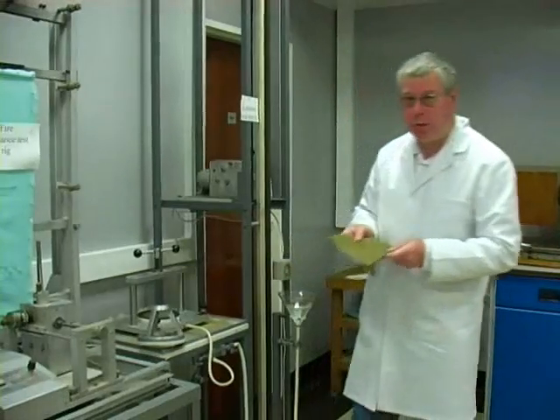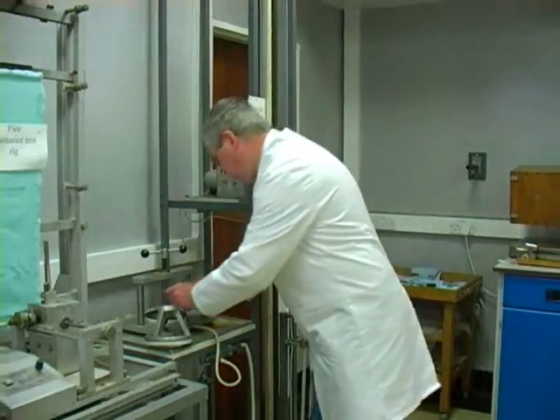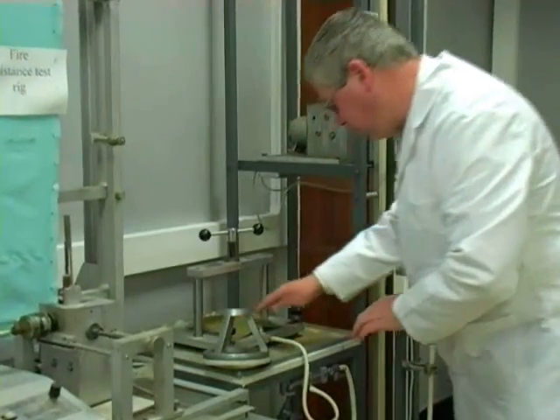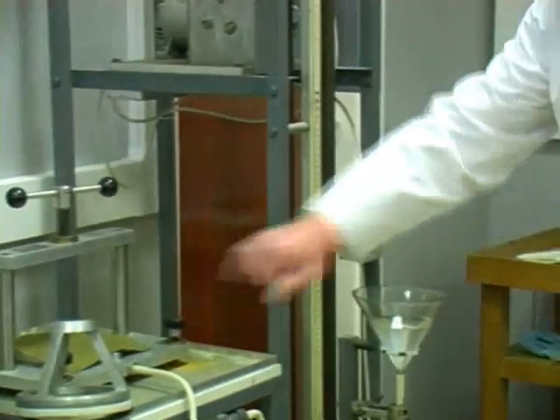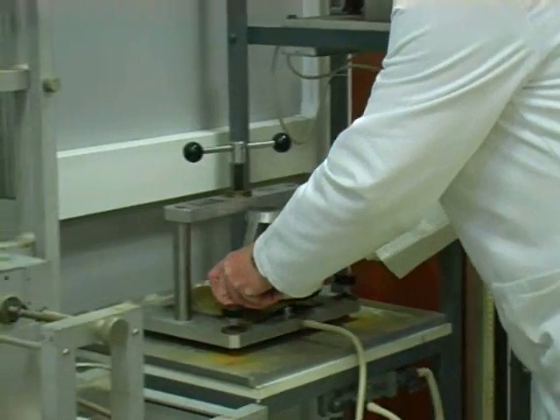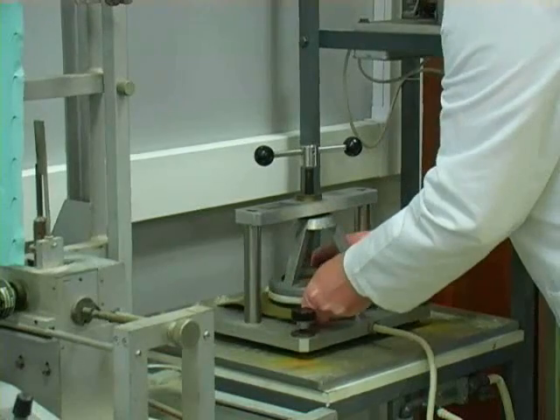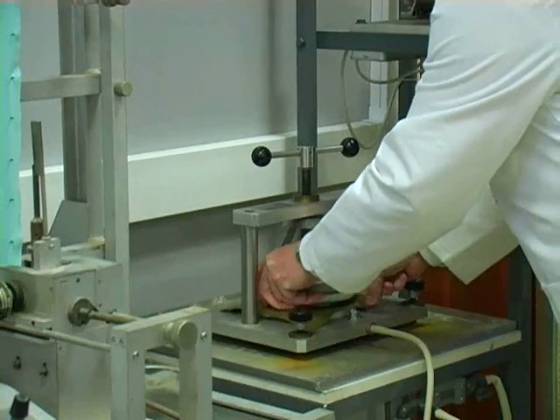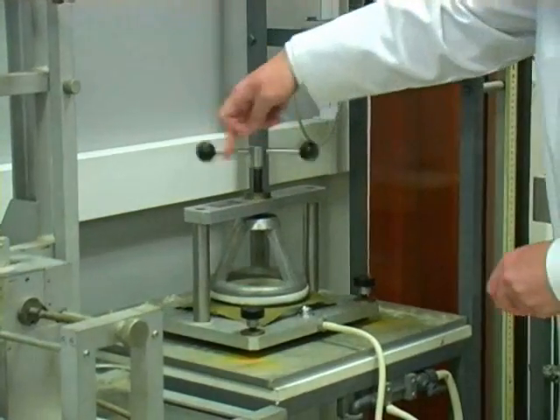If a fabric passes this, you could virtually make a boat out of it. So we put our fabric on top of the water here. The water's here in a funnel, passes down this tube and comes out of a gasket there, and then we seal our sample into the device.